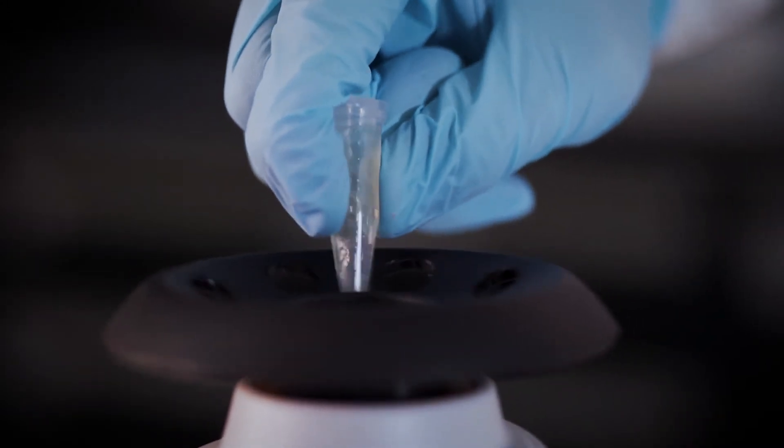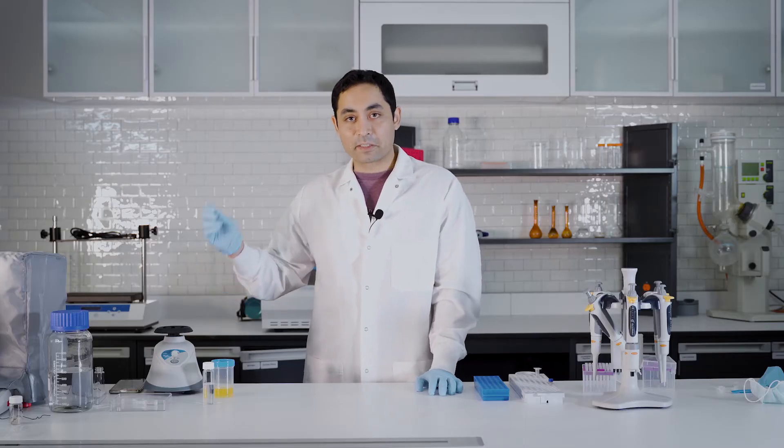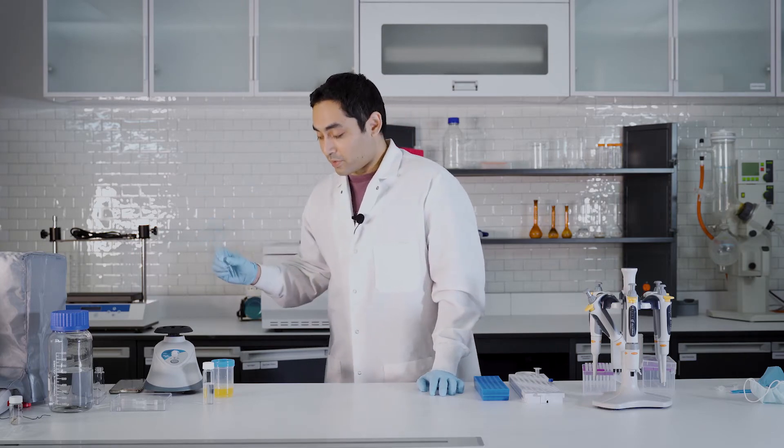All right. So now that we vortexed, we got our precipitate out, we need to go ahead and spin this guy down. So let's go put this in the centrifuge.